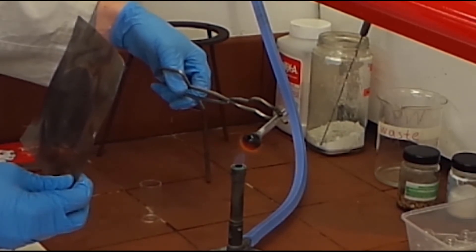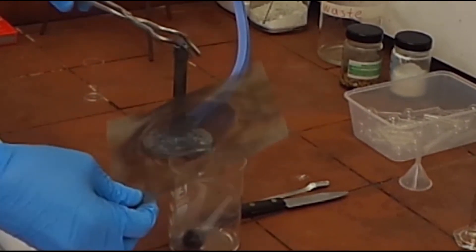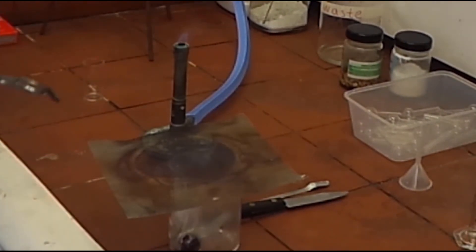Once the bulb of the tube is red hot, plunge the tube into a beaker of water and cover with the gauze mat. Ideally, you want the bulb to smash completely. Turn the Bunsen burner back onto the safety flame.